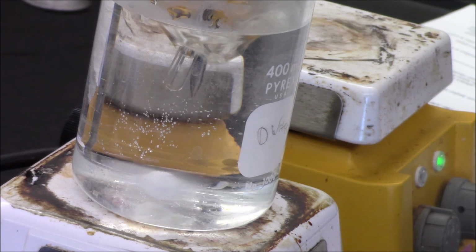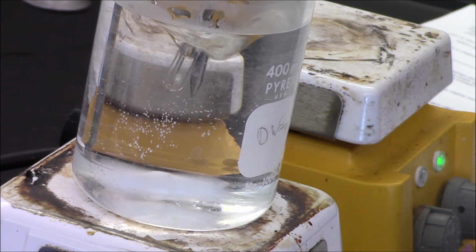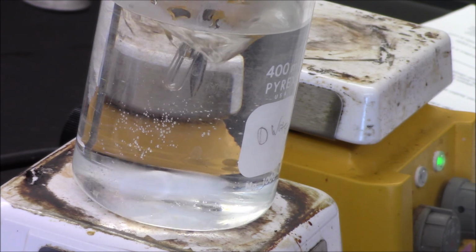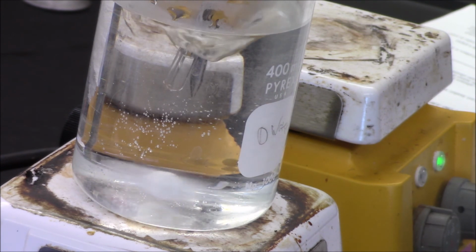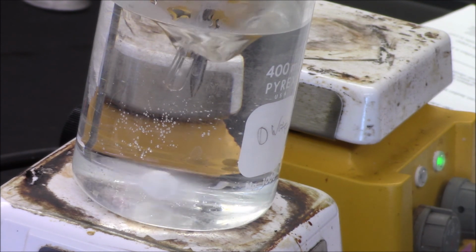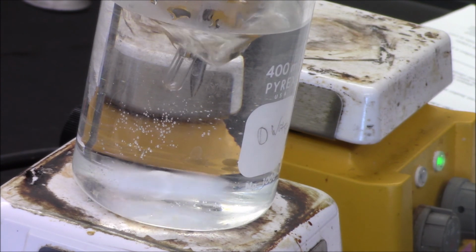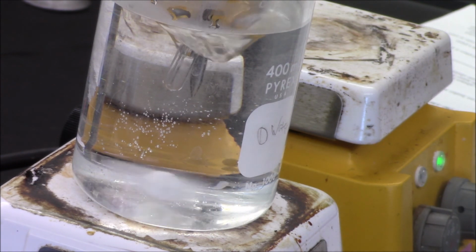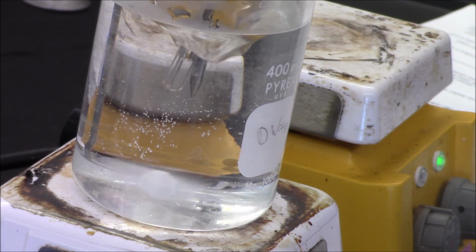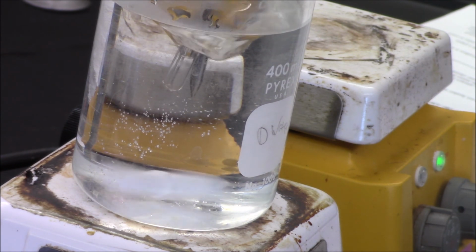And if you look, the formation of bubbles is starting to slow. So that's also a good sign. And then of course, as I see that, it looks like maybe, I don't know. I think it's slowing down. We're at 52.9. I don't know. 52.8. I do think it's slowing now. I am starting to get concerned because the volume is getting a little low.